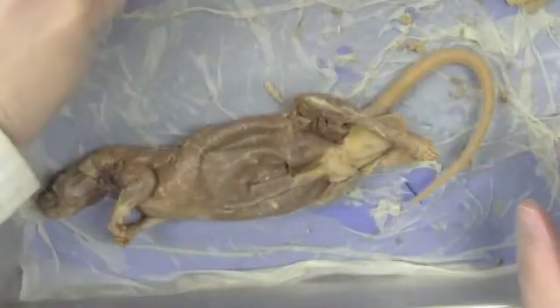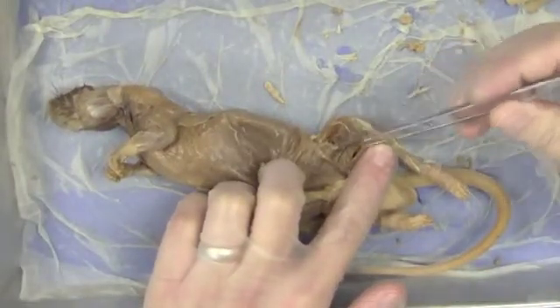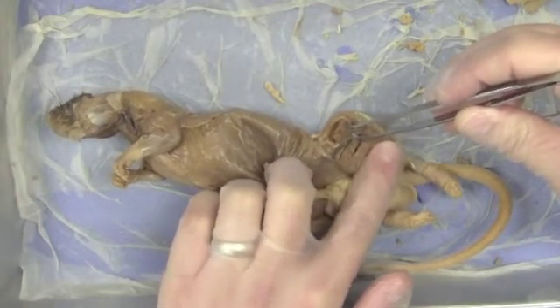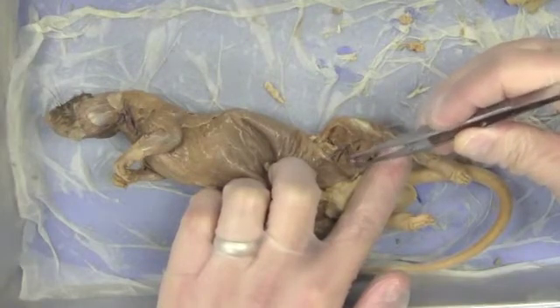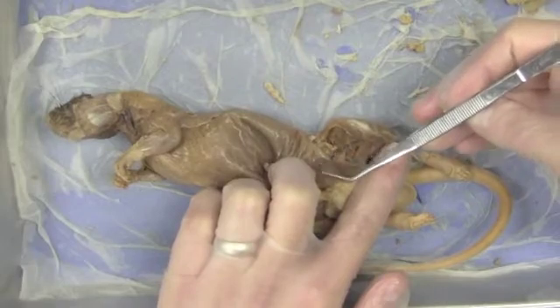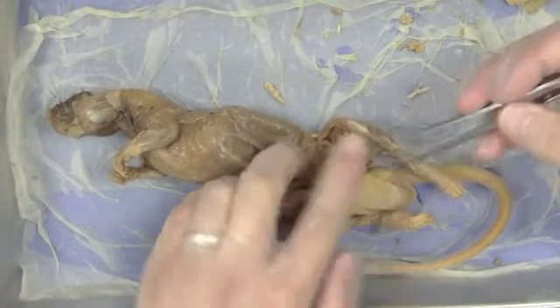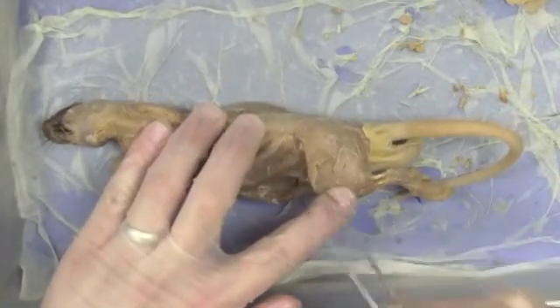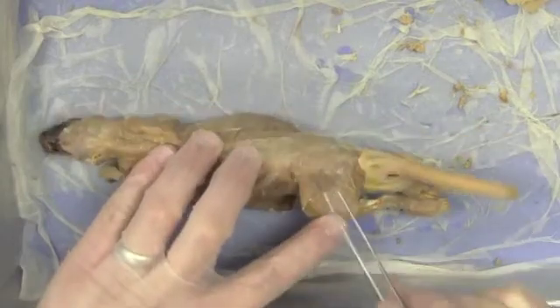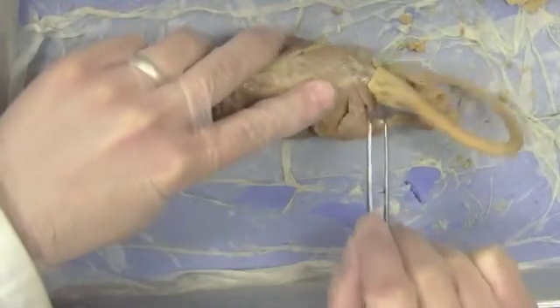Let me do a quick review before I flip them back over: tensor fasciae latae, rectus femoris, vastus medialis, pectineus, adductor longus, two pieces of the gracilis, and between them is the semitendinosus, and in the back is the semimembranosus. Back to the outside: TFL or tensor fasciae latae, vastus lateralis underneath that, large gluteus superficialis, biceps femoris, and the back side of the semimembranosus.